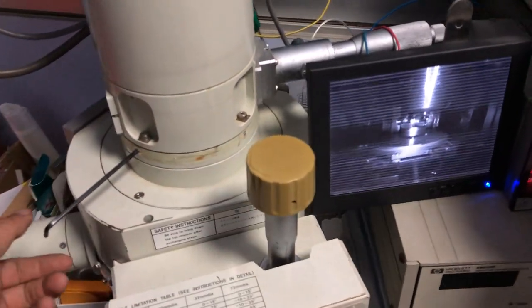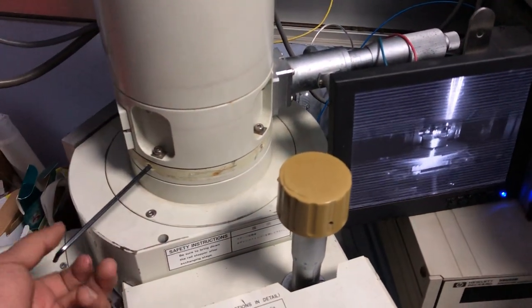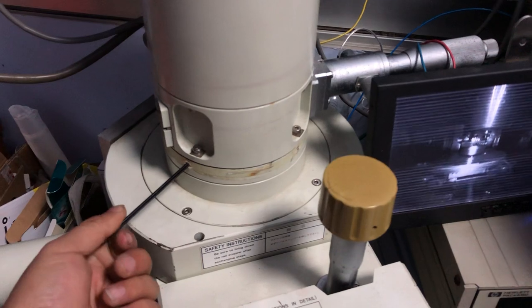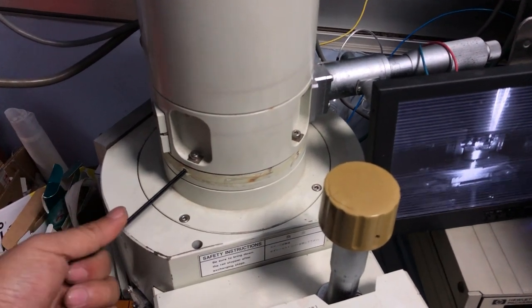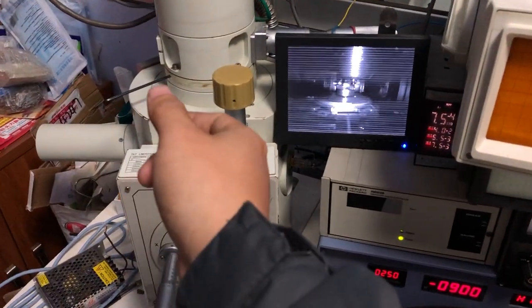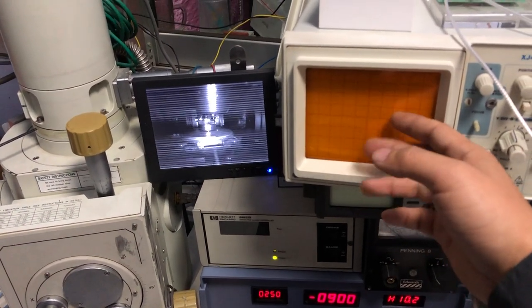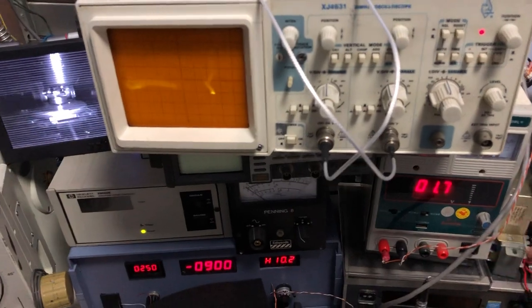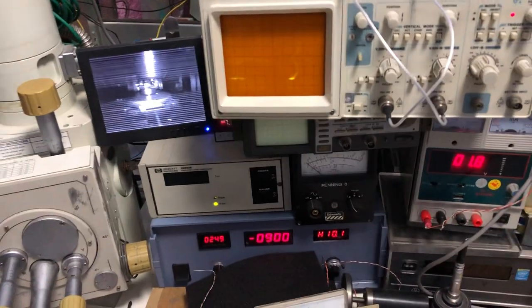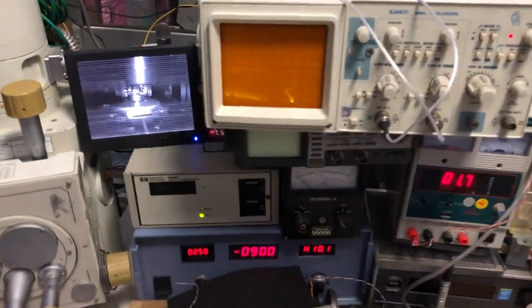So today what I do is loosen these screws a little bit and twist these screws with this driver a little bit. And when I turn this driver a little bit, I'm watching this screen and adjusting the focus to see whether the image can still be shifted. And now we can see basically a pretty clear image.